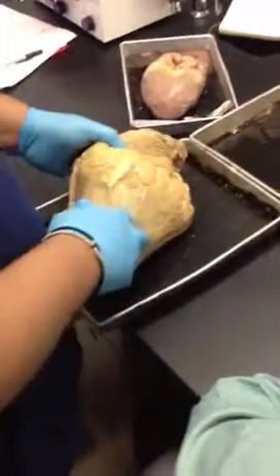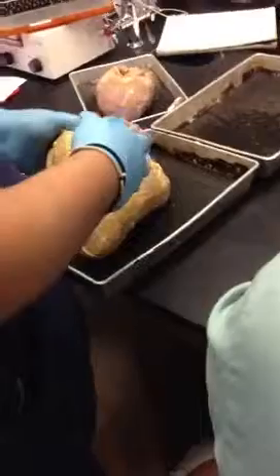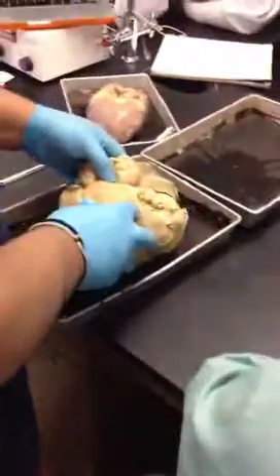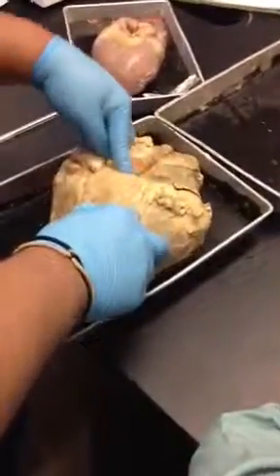I would prefer great cardiac vein and middle cardiac vein than the anterior and posterior interventricular artery. Typically, veins are closer to the surface, so you'll see those better than you should see the arteries. But let's flip this back over. And then up here, in this area right here, the coronary sinus.